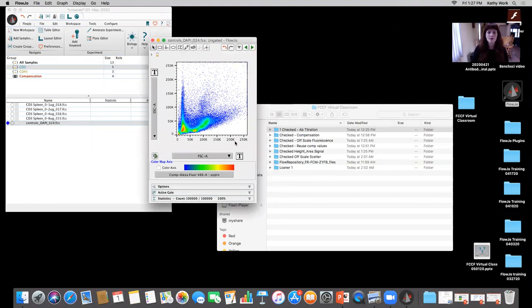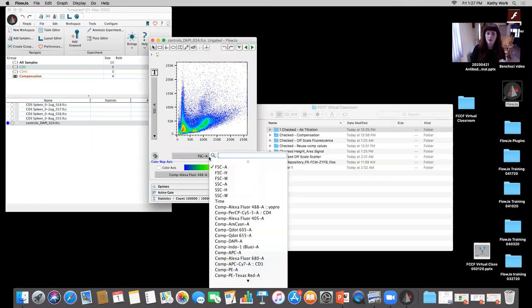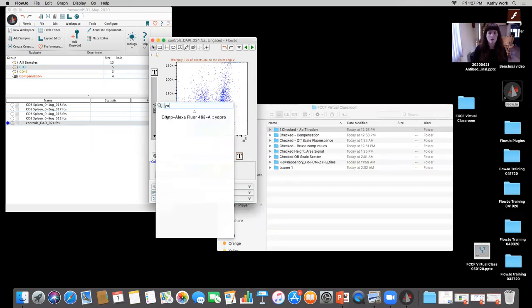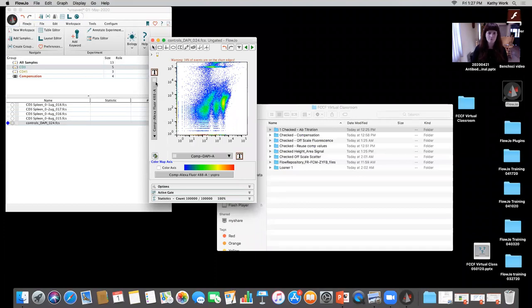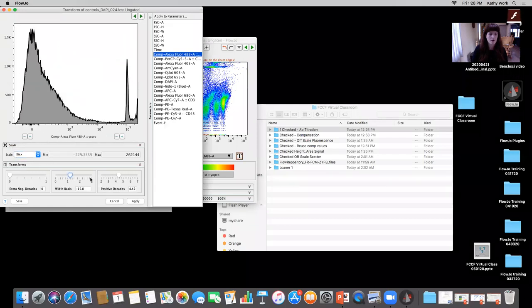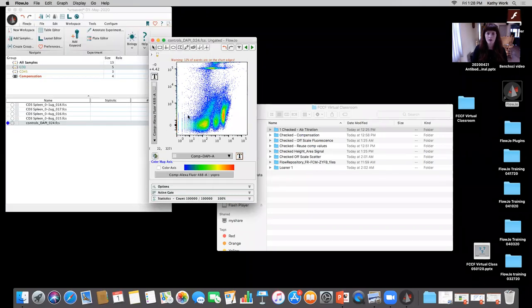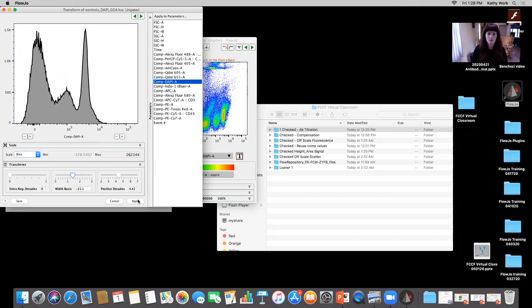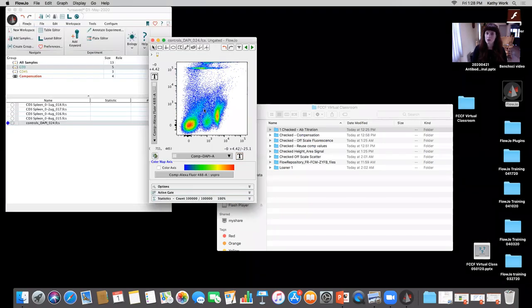Okay, so what I like to do first, I'm gonna go ahead and look at DAPI, which is our viability marker, and then I'm gonna look at YO-PRO, which the user utilized for apoptotic cells, okay? I'm gonna come into the transform button, I'm gonna customize the axis, I'm gonna change it to Biex, okay? And I can adjust that width basis a little bit. I like to make sure that my scaling looks correct. And typically when we're looking at multiparametric data off of the Diva instruments, I'll look at it in Biex. And you can see once I make those changes and adjust the width basis, it looks much, much cleaner.